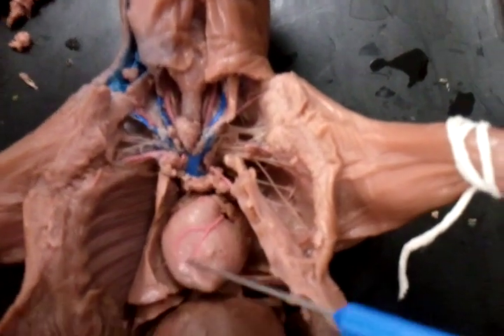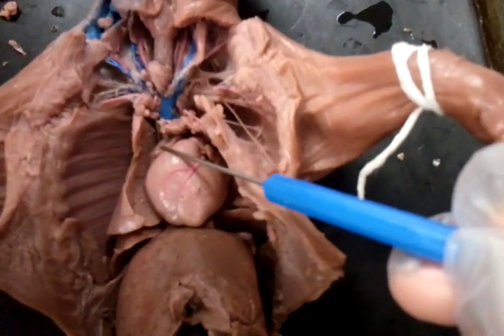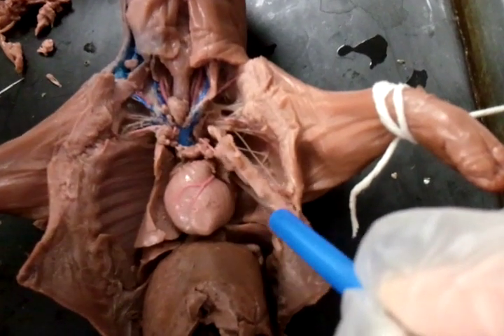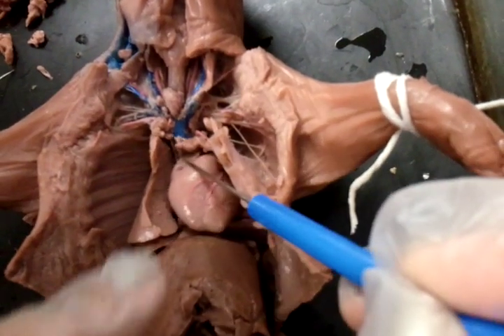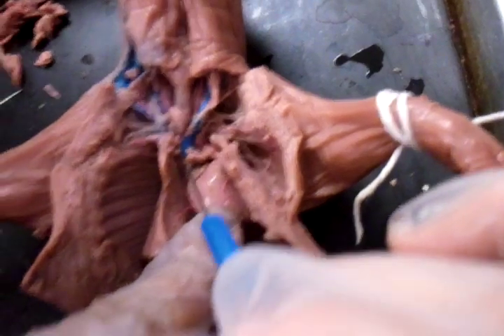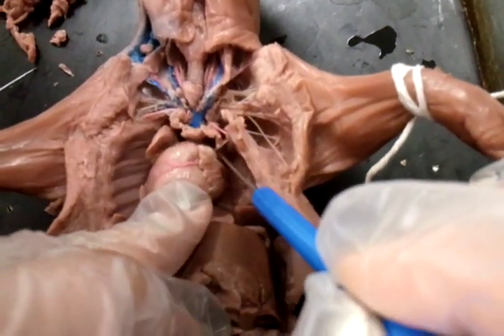Coronary artery. Right auricle, left auricle, the flaps. Aorta. Pulmonary trunk.